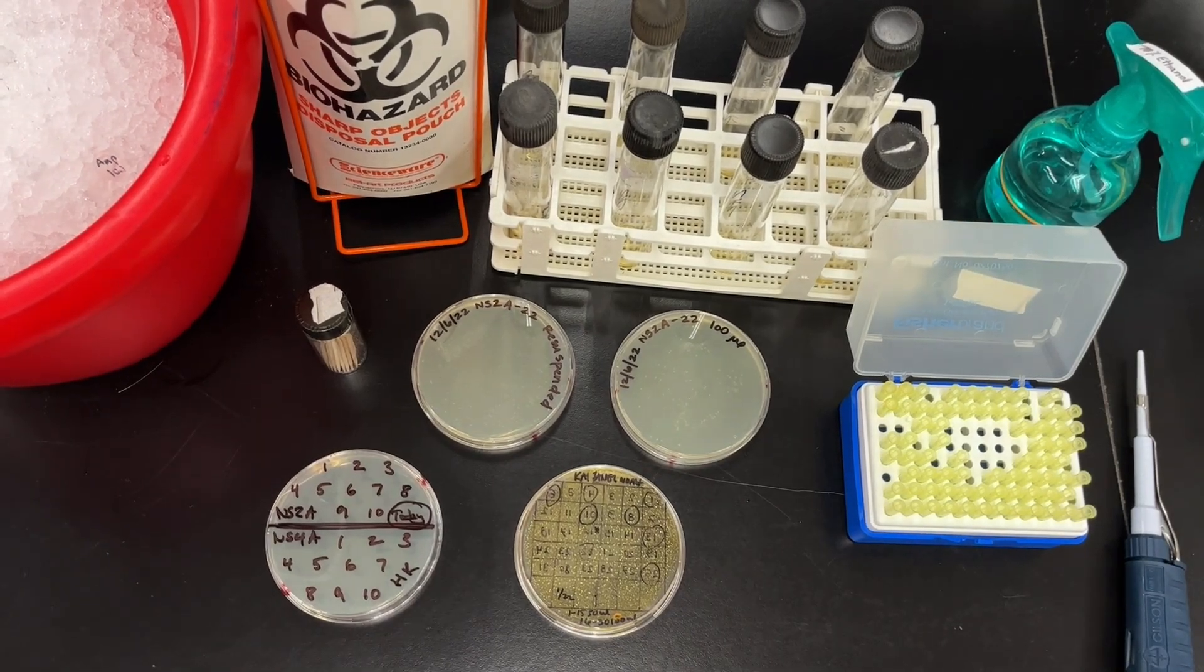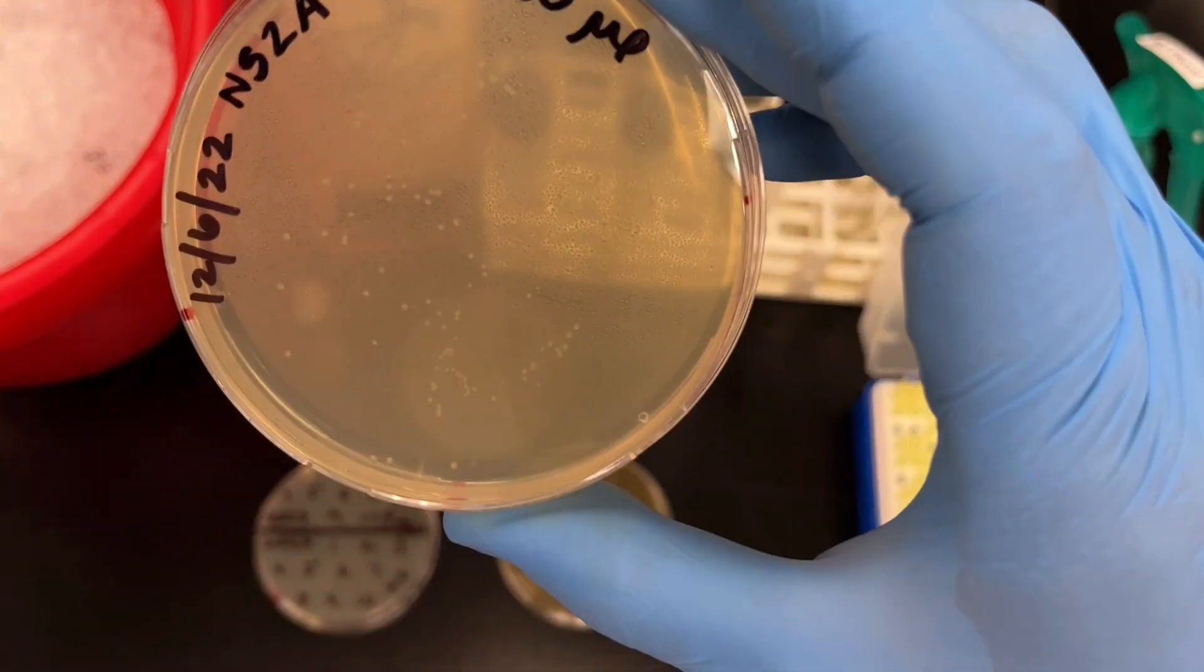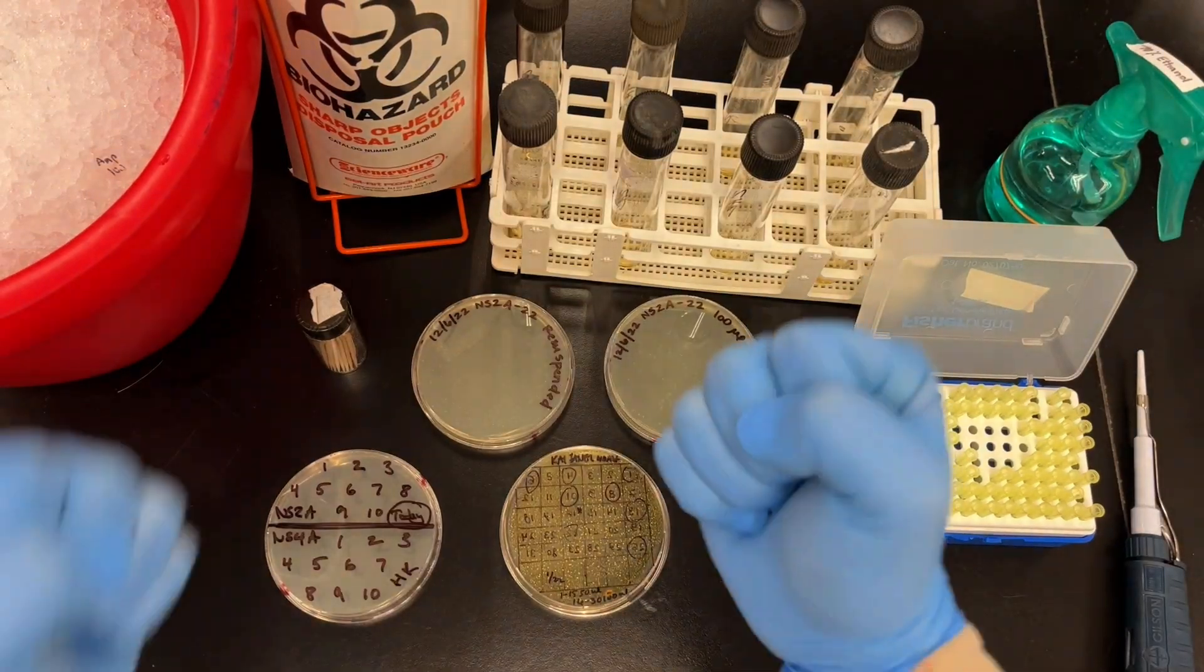So you've performed your Gibson, ligation, cloned a gene, whatever, did your transformation, and you see colonies and you see success. And there's nothing that feels better than a successful cloning attempt.